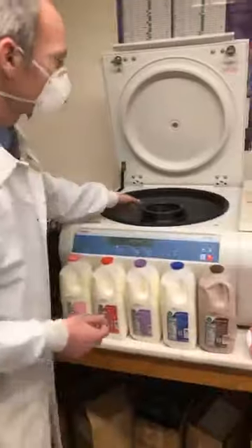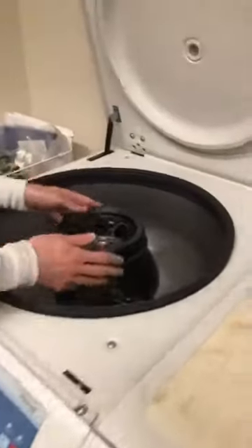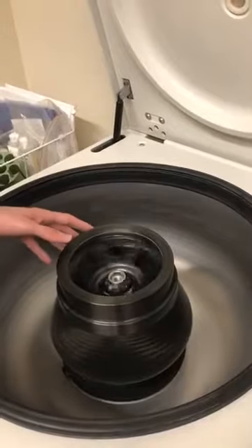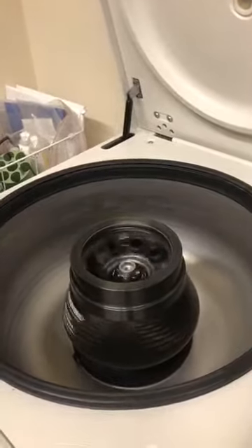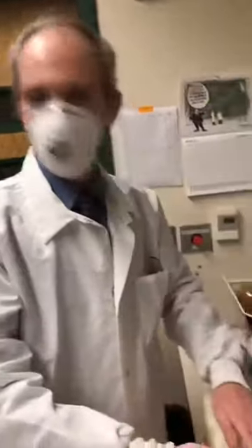To do that, I need to spin these really fast to force all the water down, to get it away from the fat. What we have here is an instrument that's going to spin these samples really, really fast — it's called a centrifuge. By doing so, it can apply really great amounts of force. In fact, it will produce 14,000 times the force of gravity. Imagine if you were under 14,000 times — you'd get crushed. That's the whole idea here: it's just going to crush the sample and force the water to separate out from other things.